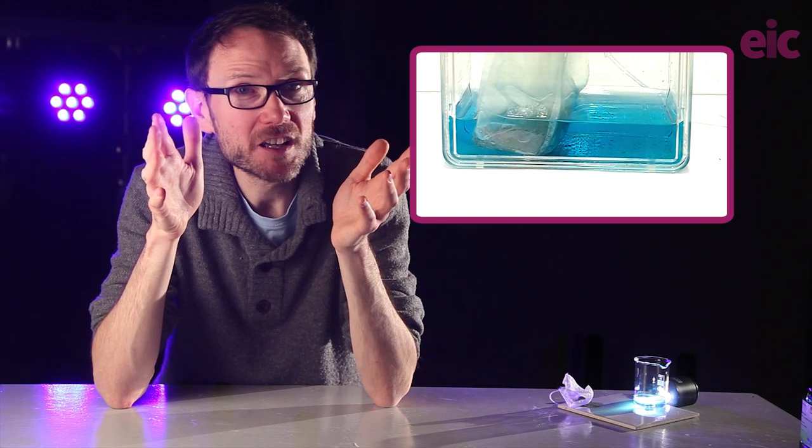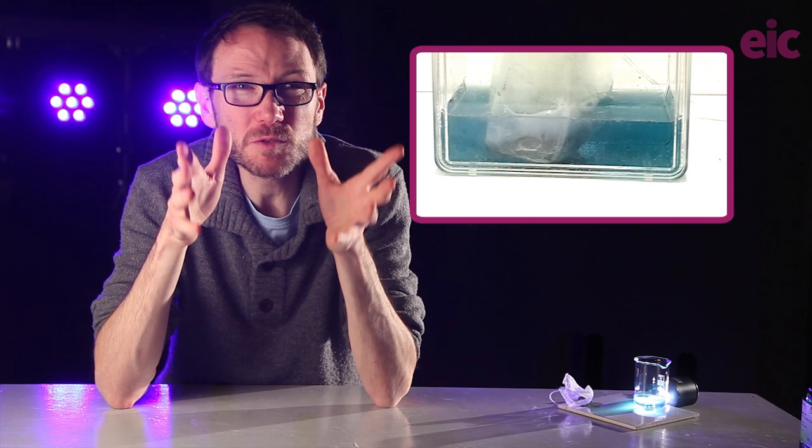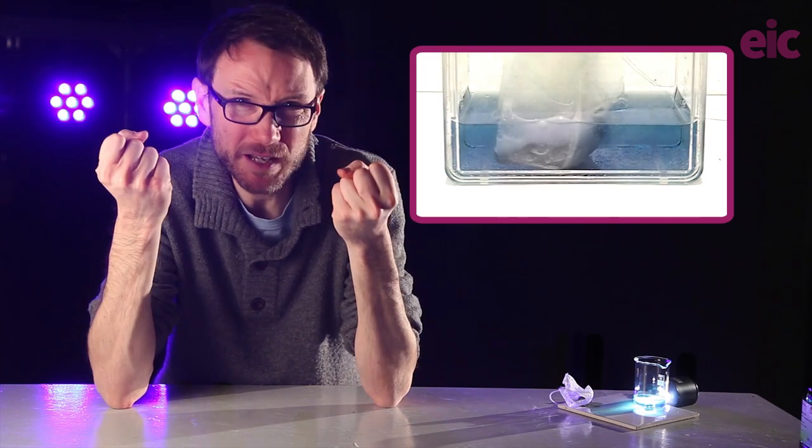It works, but still 35 to 40 minutes. Doable for a lesson, but we want better, right?